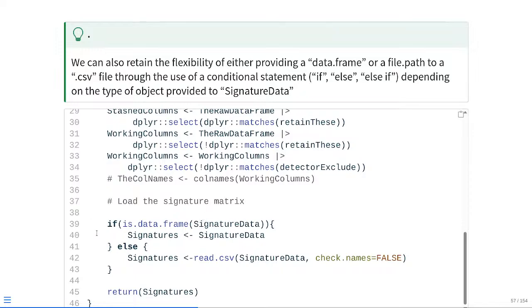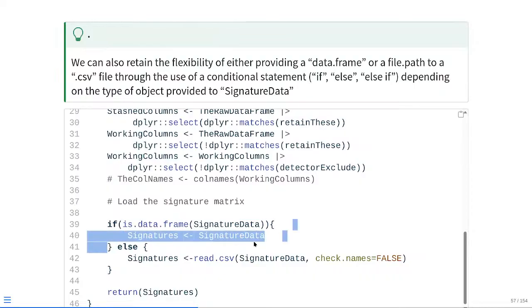And then at this point, we're starting to write out the conditional. Remember, a conditional is only evaluated if whatever's between the first parentheses here comes back as being true. So if the signature data object we pass in is a data frame, this will come back as true. And then at this point, the code within the little curly brackets will be evaluated, in which case signature data is just going to get saved to signatures.